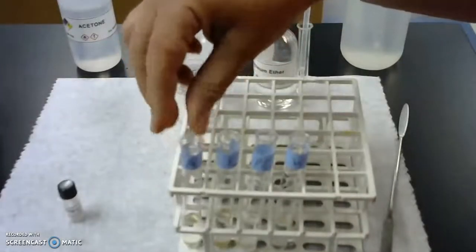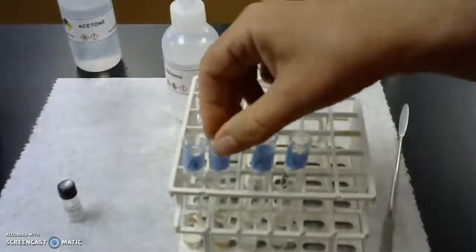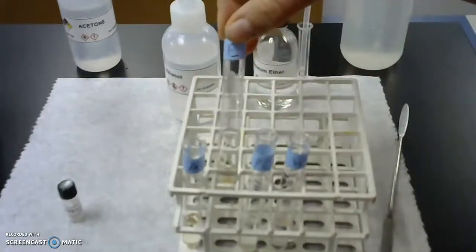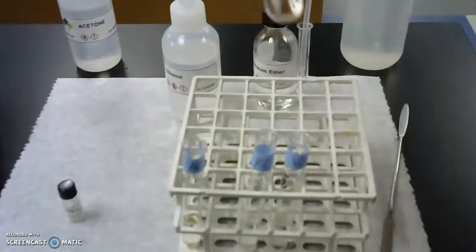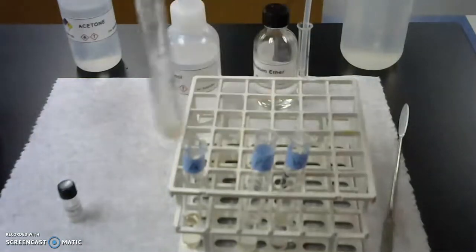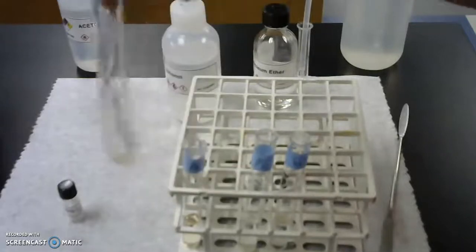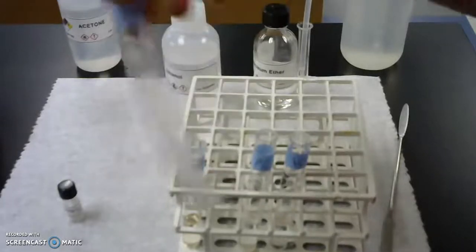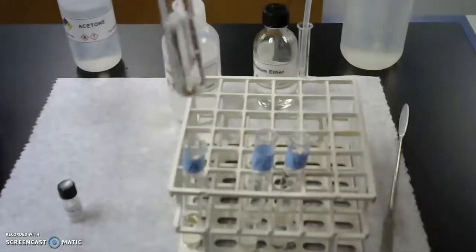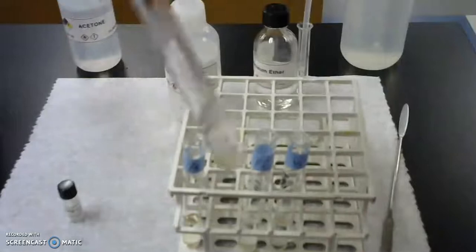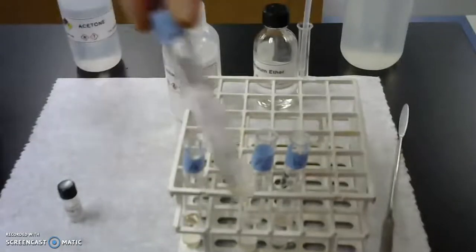Now I'm going to do the same thing for the ethanol. I'm going to shake it around and mix it up and see if it dissolves or not. So you can see there's a little brownish dot in the bottom—that's the acetanilide. Now I'm going to shake it to mix it and let's see what happens. Does it dissolve? Does it not dissolve? Is there any left? You need to look, observe, and record your results.